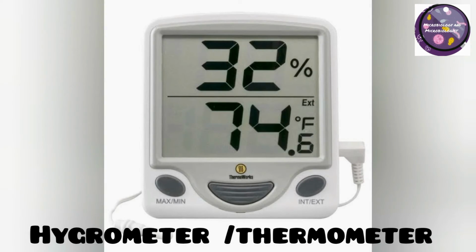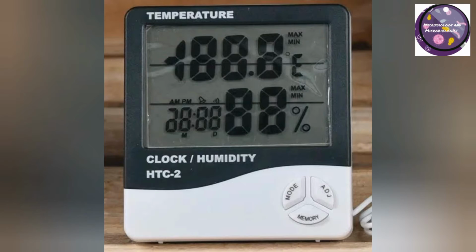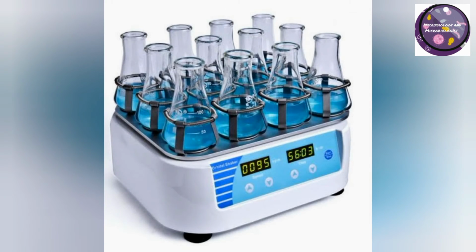Hygrometer or thermometer. Hygrometer or thermometer are also important for microbiology lab to check the temperature and humidity. A hygrometer is an instrument used to measure the amount of water vapor in air, in soil, or in confined spaces. Humidity measurement instruments usually rely on measurements of some other quantities such as temperature, pressure, mass, a mechanical or electrical change in a substance as moisture is absorbed.